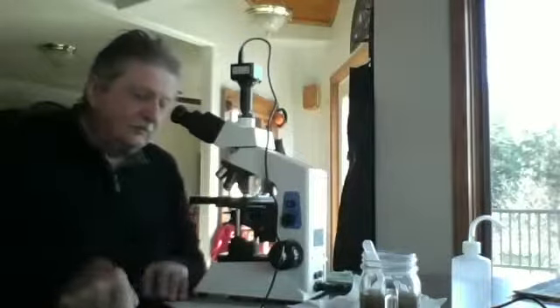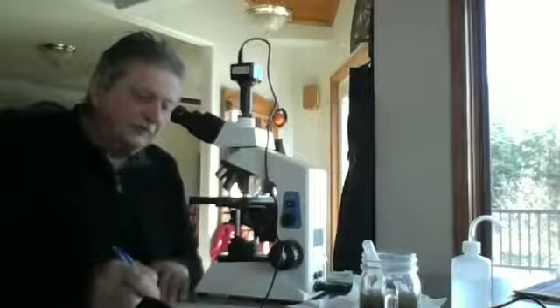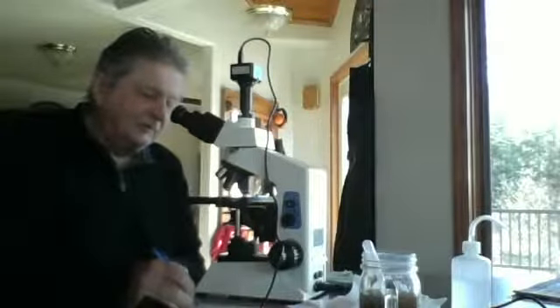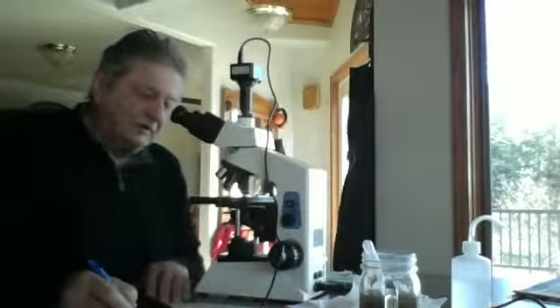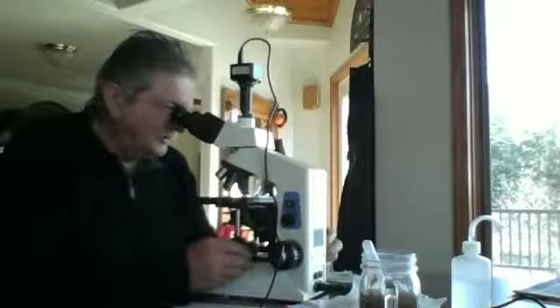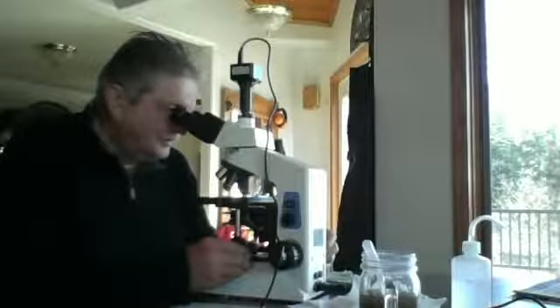I'll count 4 flagellates in that view and 0 oomycetes, recording this, and no actinobacteria, no amoebae, and no ciliates. I don't know what to expect about finding amoeba in a soil sample and a compost tea sample. It wouldn't seem like that would be their territory.